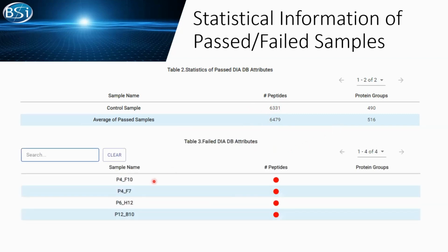Here, we can see that all my failed samples have low peptide numbers. If there were another field, it would also be listed in red, but here it's just low peptide numbers. So up to here, we get an idea of what attributes are failing in my 20 samples. But what's the issue? What caused the low peptide numbers? We have to figure out where this problem is coming from, so we start to get into the data to see where the issue is coming from.